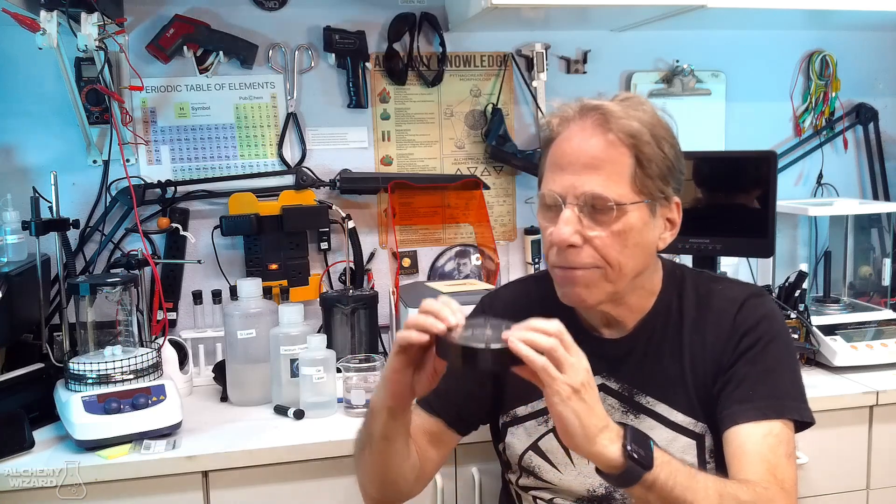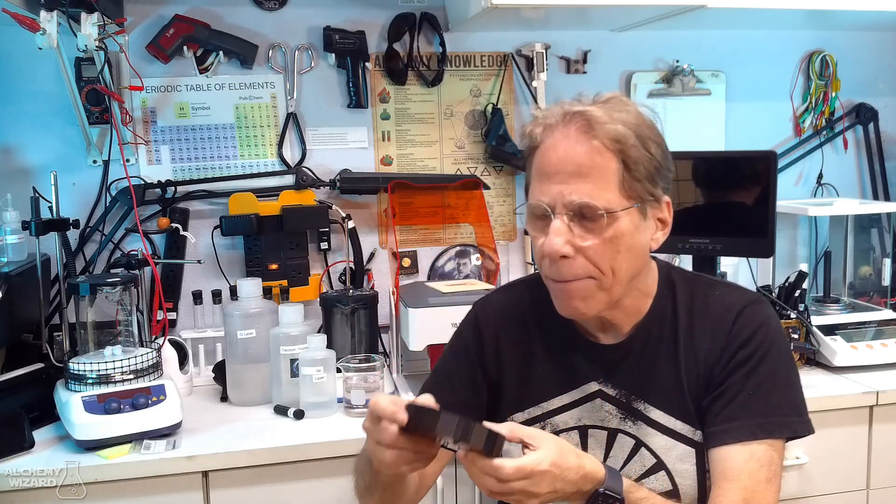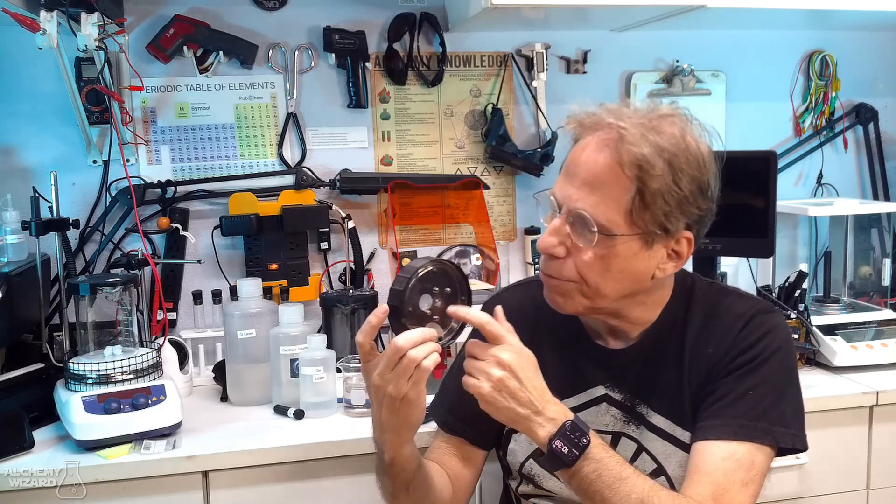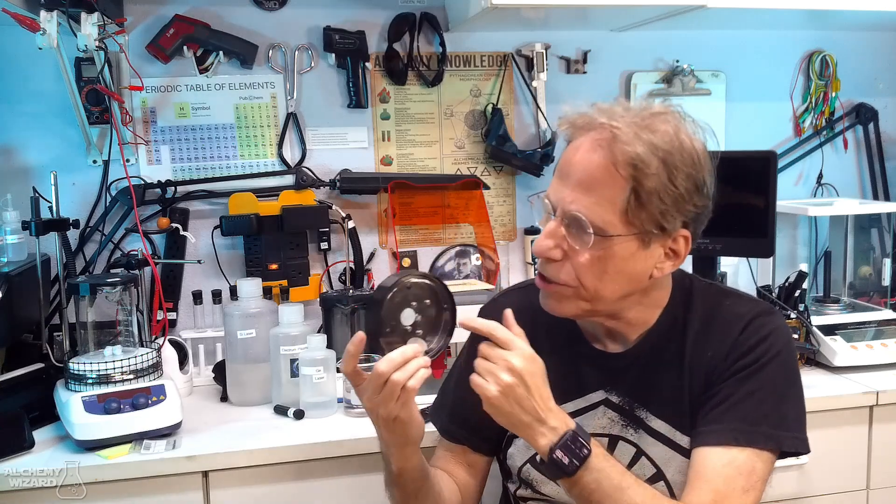I put my petri dish on a black slate bottom, so I don't need to do anything about the bottom. And you don't want to tape the bottom, because what will happen is if you do miss the target and you tape the bottom of the petri dish, you will wind up laser engraving the back side of this petri dish.